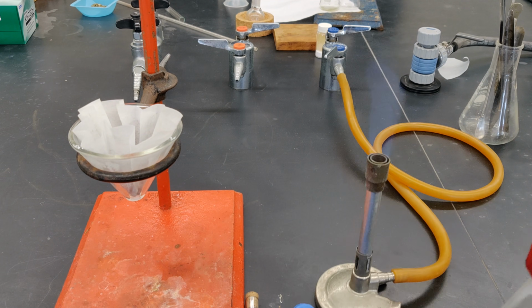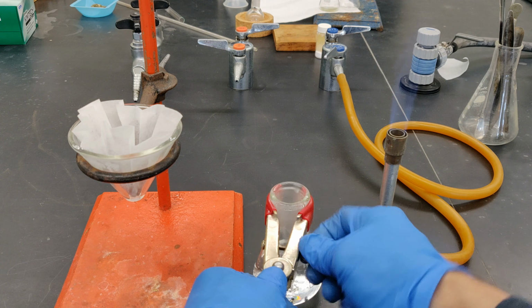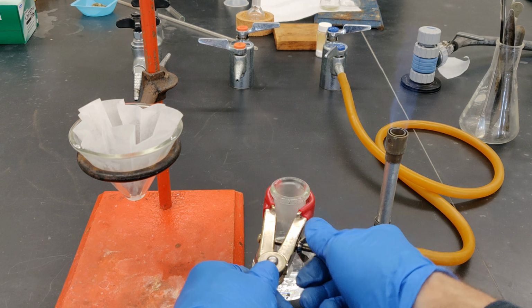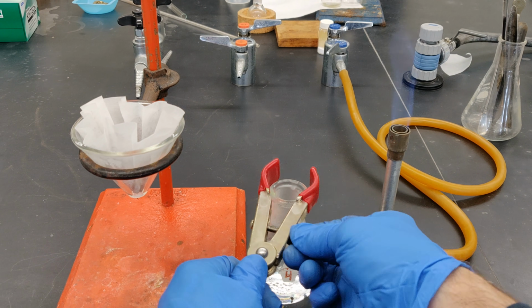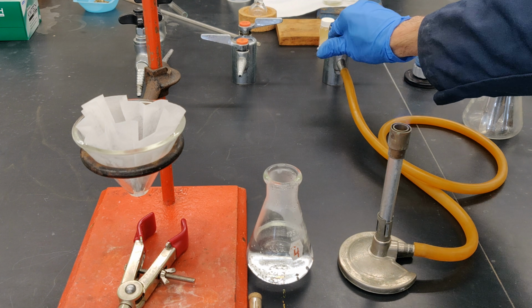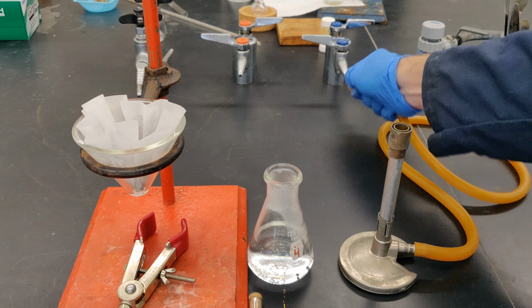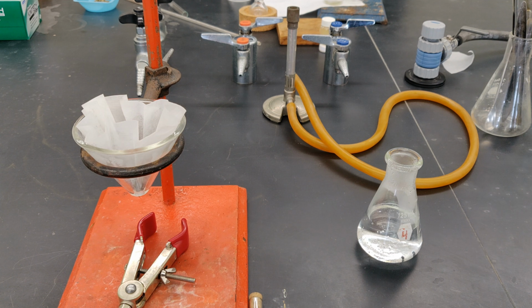To avoid the flask accidentally tipping over and spilling your product on the benchtop, don't prop up the full clamped flask by resting the handle on a raised surface. Always unclamp the flask before letting go of the handle. Turn off the flame by closing the gas tap. To allow for recrystallization of cinnamic acid to occur, leave the hot flask to cool completely undisturbed in a safe place on the benchtop.